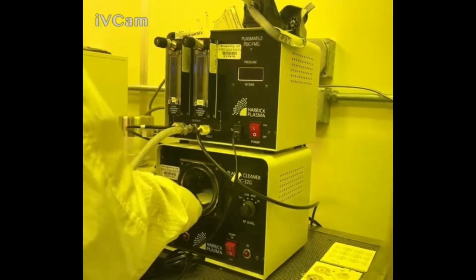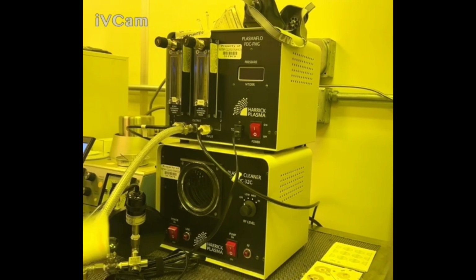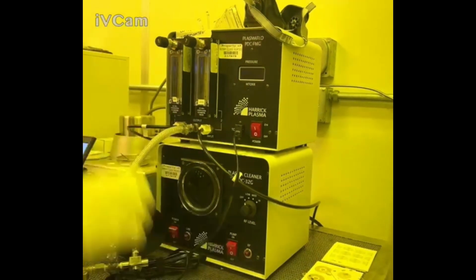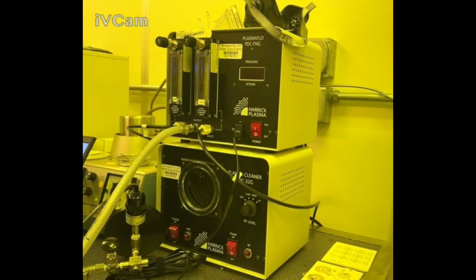What you're going to do next is take a pair of tweezers, pull out your sample, and immediately put it into some kind of protective container with a top and bottom, preferably vacuum sealed if you can, just to protect the surface of the item that you just treated. But if you don't, it shouldn't be too much of an issue. Just note that plasma treatment does decrease in intensity over time. So the first thing you want to do is take a contact angle of your sample untreated. Take a contact angle of your sample immediately after being treated, and then follow up maybe an hour or two later, or even a day or two, or a week or two, just to see if the treatment still holds after a long period of time.